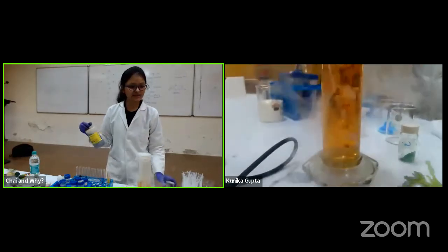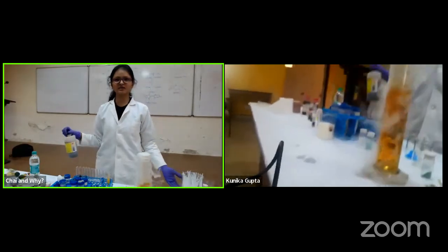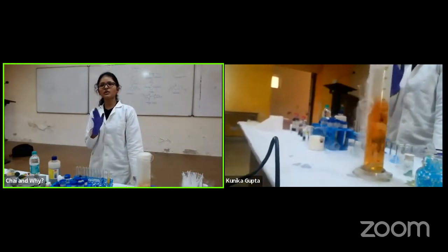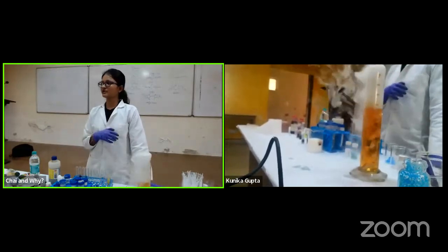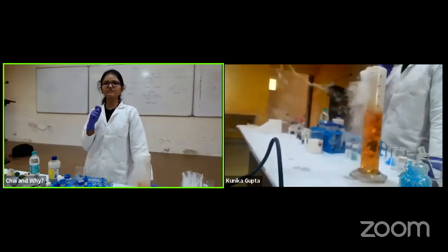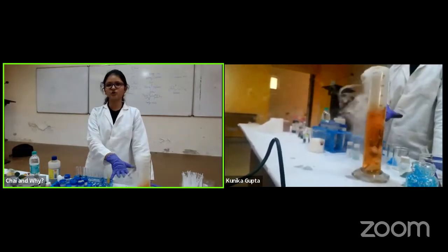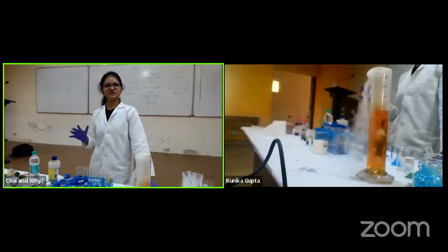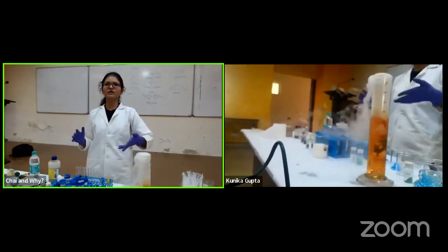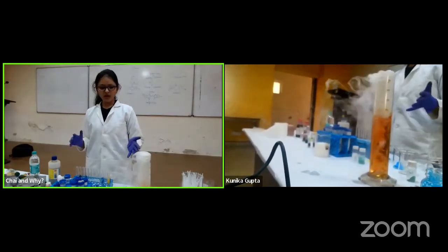So why has it happened? What did the carbon dioxide do? Carbon dioxide, when dissolved in water, gives you carbonic acid, which is H2CO3. And it's a very mild acid. That's why the pH only goes down to about 4.54. If the result had been a very strong acid, then the pH would have gone much lower. But it does not.